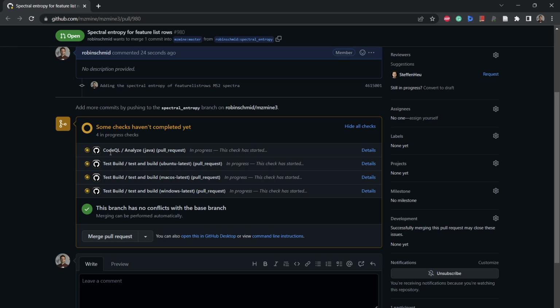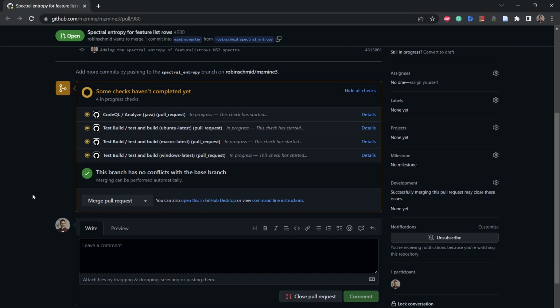There's now automatically some task running. So we have some continuous integration, some tests running. It's building MZmine on Ubuntu, on Mac, and on Windows, and is then also running some of the tests. And once this is done, we can even directly download a version for each of these systems. We can download versions, we can give them to collaborators, so we can easily distribute this test version. Yeah, so it's a very easy way of getting people to try out your new stuff.